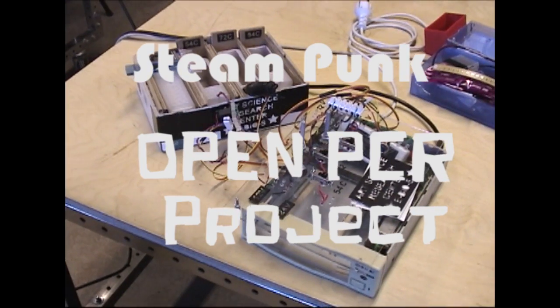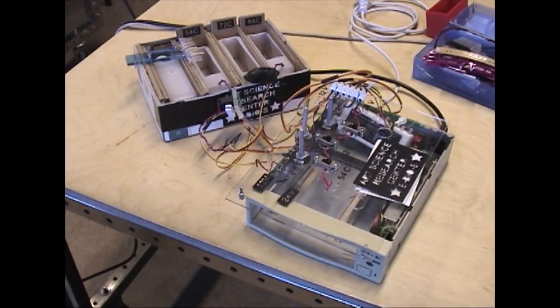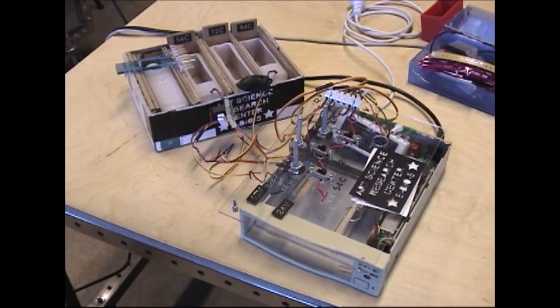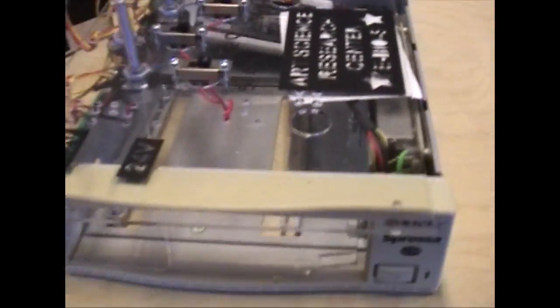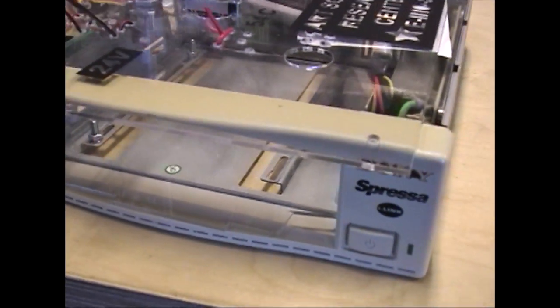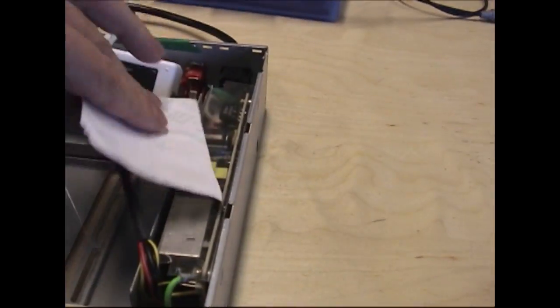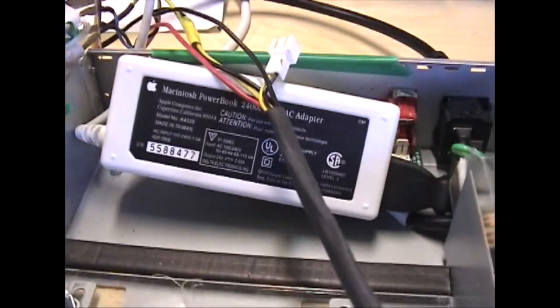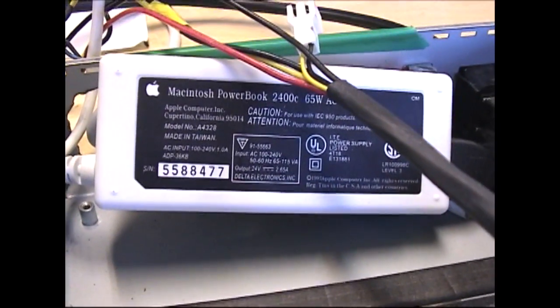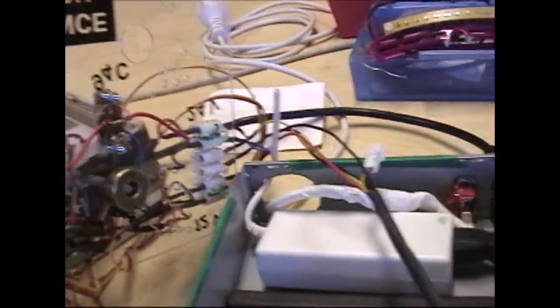Okay, here we have a simple PCR machine, the simplest in the world, made from scratch and recycled materials. It all started with an old Sony CD recorder, which is used just for the 12 volt adapter here, and another adapter was recycled from a Macintosh PowerBook, 65 watt, 24 volt.